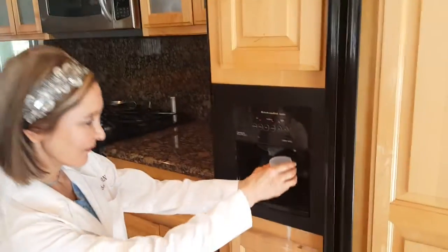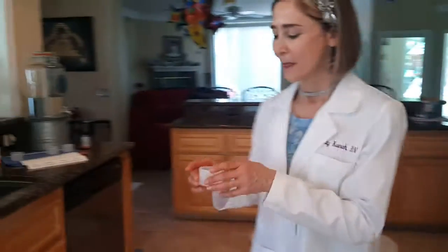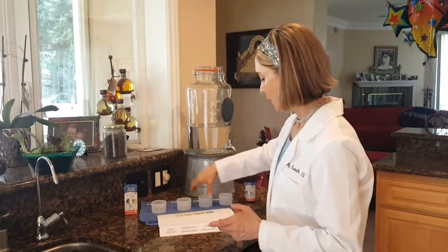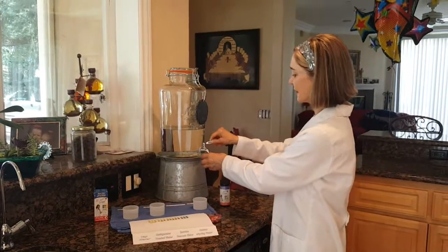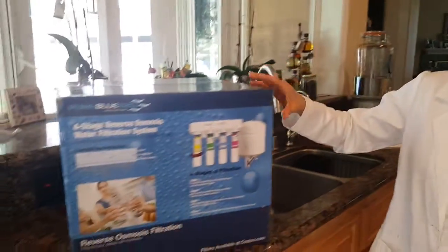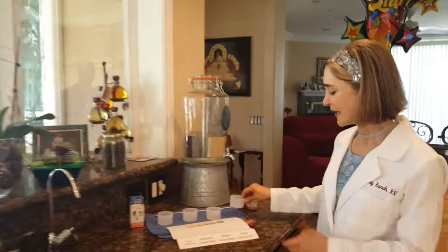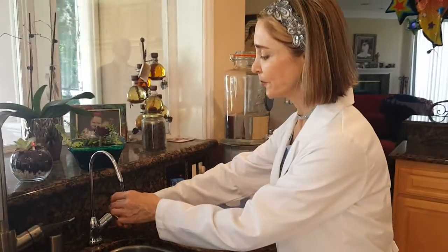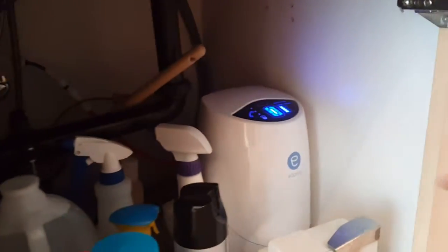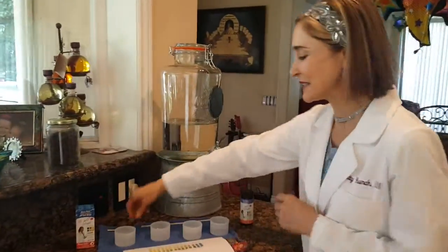I'm going to get it from the refrigerator — perfect — and that's filtered water. My next specimen will be reverse osmosis. The reverse osmosis is this system right here. You're going to see why I'm taking this back. And then my next source will be from the Amway eSpring water, and that is down here.